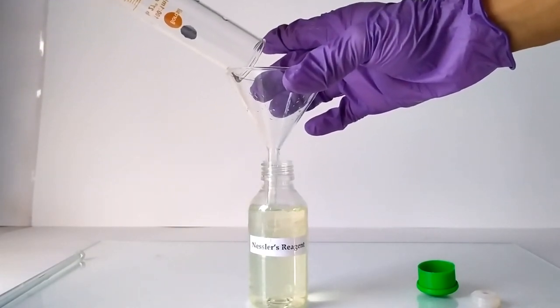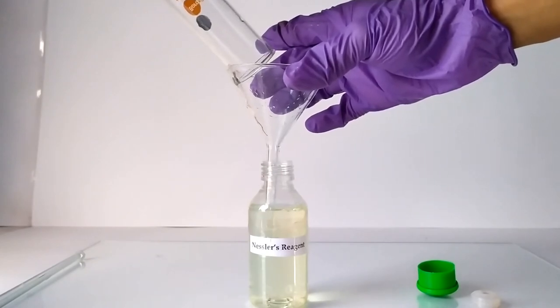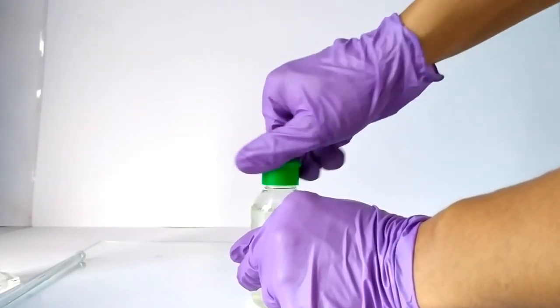On storage of the reagent, precipitates may develop. This will however not affect the performance of the reagent.